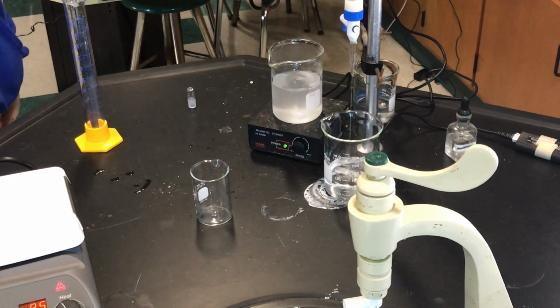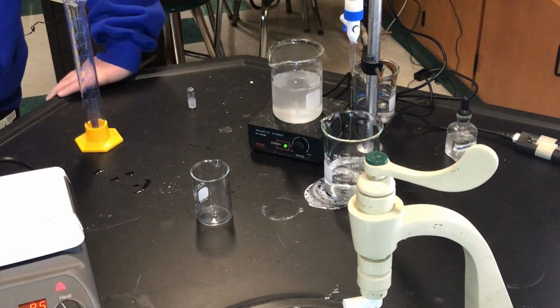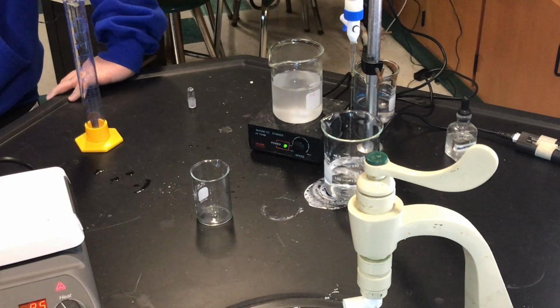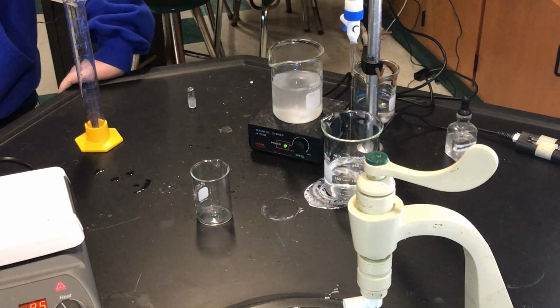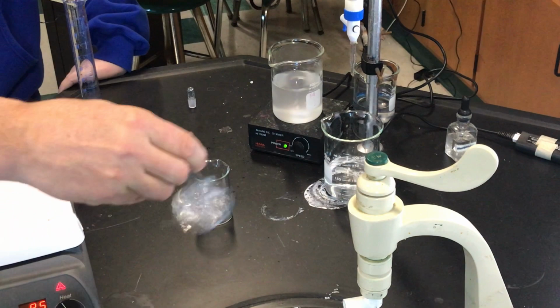And what we're going to do is carefully add our hydrochloric acid into a volumetric flask. We should have done it this way. You can say what a bad chem teacher I am online. But all I'm doing is adding those 25, make her 50, should have made 100, but okay, it doesn't matter, because I'm mixing them now, making sure they're all mixed. I'm turning them, and then we're just mixing hydrochloric acid solution.